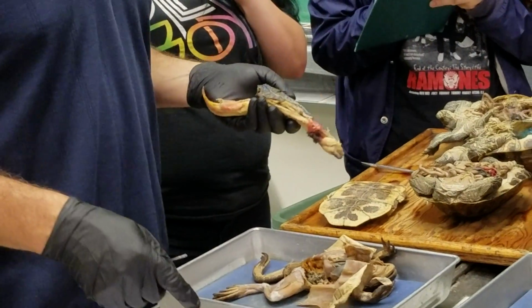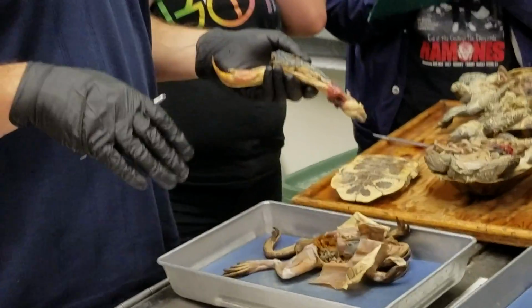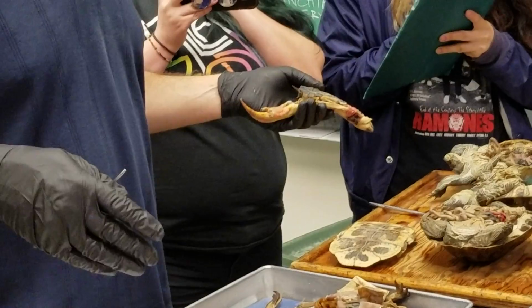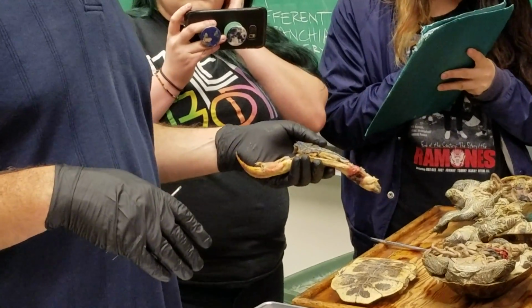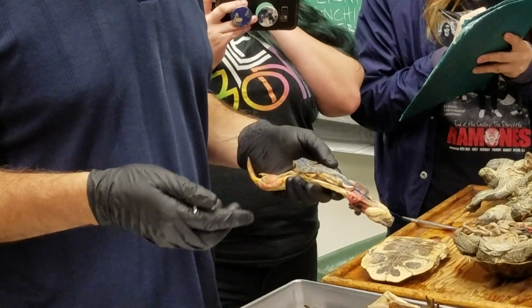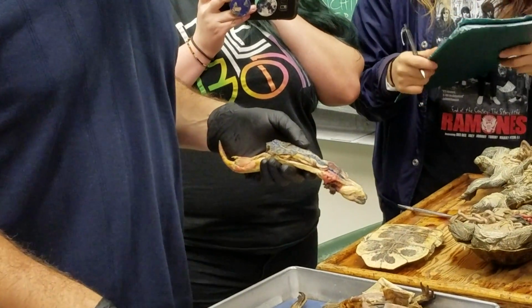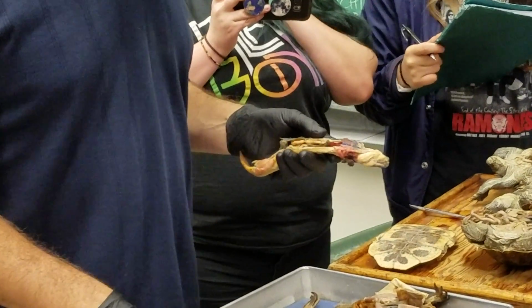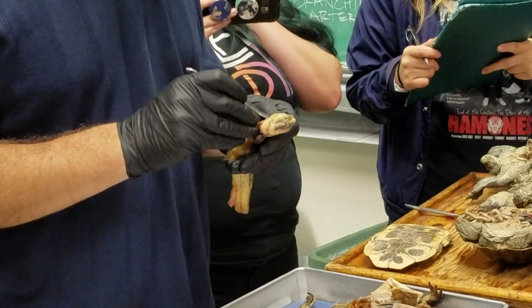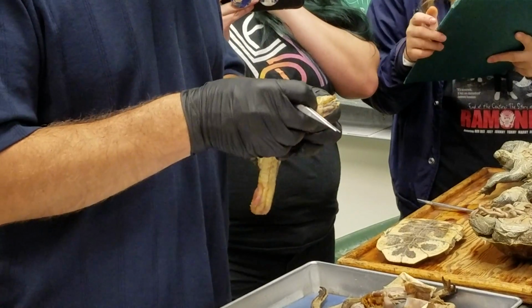In the anterior cardinal vein, nobody found. It's really challenging on these guys, but they do have one. You know that it's there. They have the same general pattern of circulation. It's just really hard to find on these guys because they're so little.